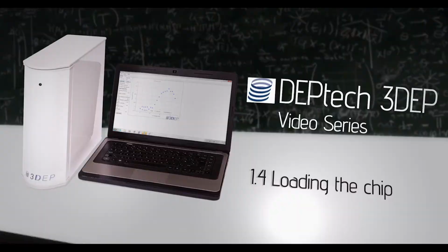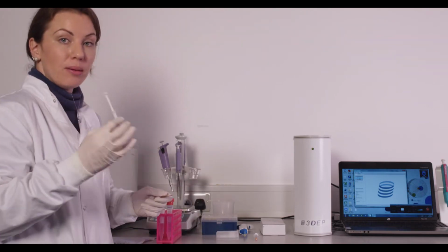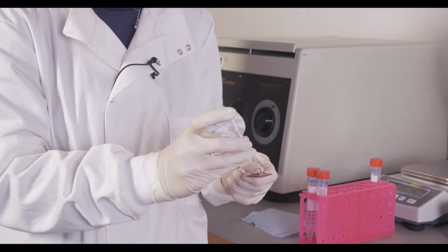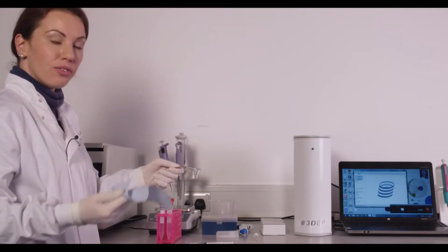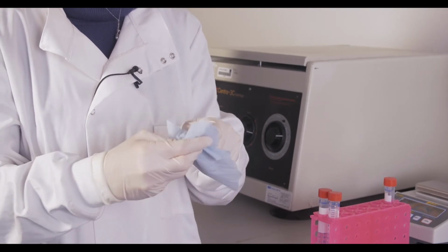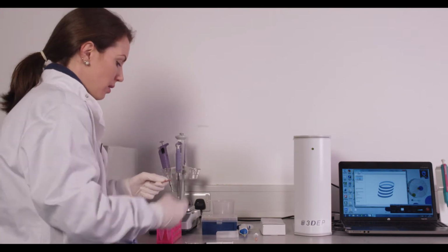After you've prepared your cell sample, you'll need to prepare your chips for loading the sample into the kit. The first thing I like to do is take fresh DEP medium and wash it into the chip. You'll get a nice little bubble forming on top of the chip, and then you take a lint-free towel and just wipe out all of that DEP medium. This cleans the chip coming out of the box and gives it a nice surface for the cells to enter into the chip.